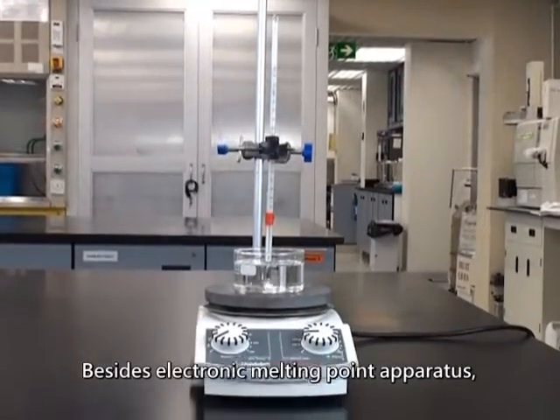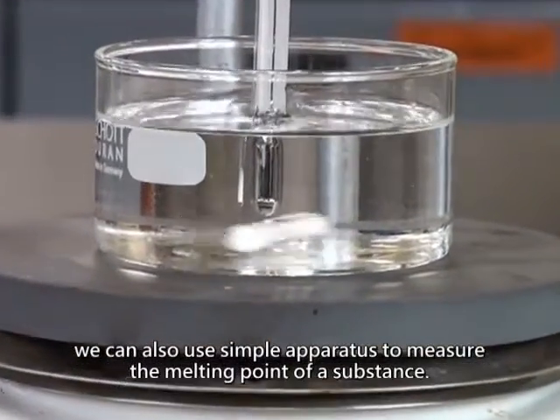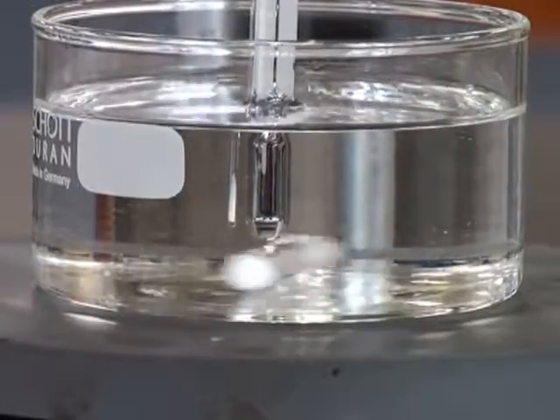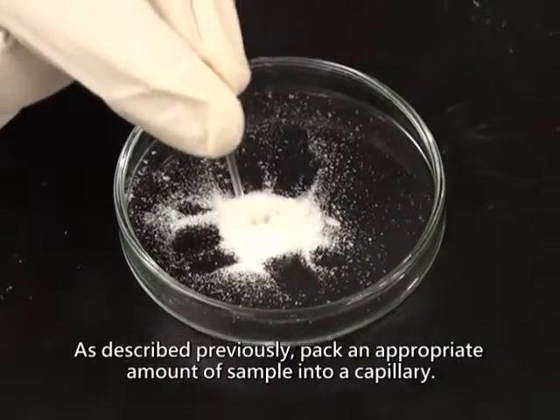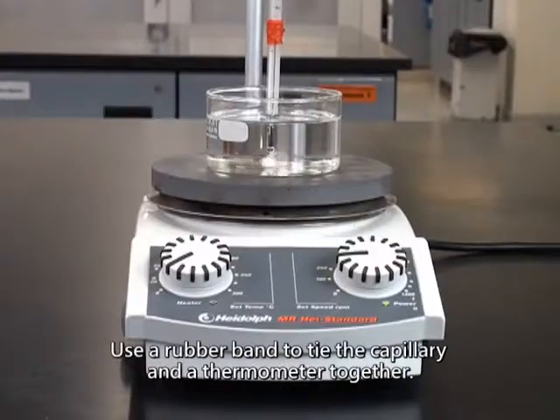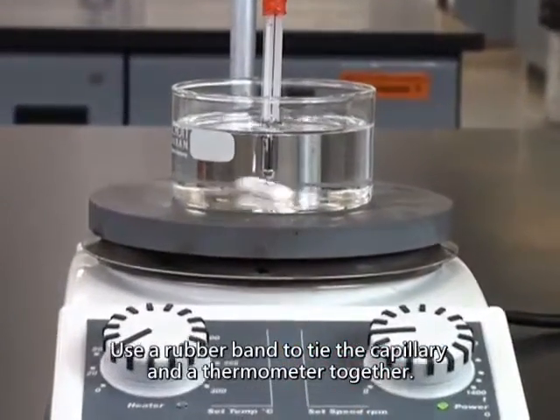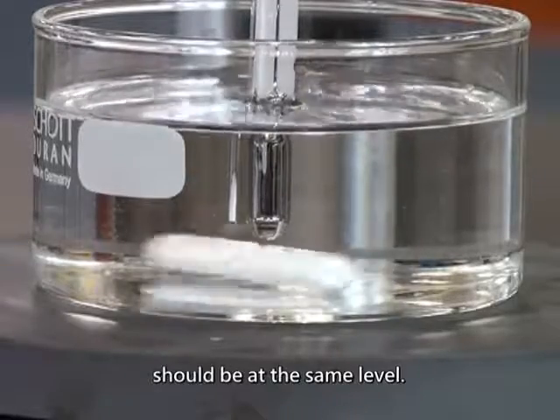Besides electronic melting point apparatus, we can also use simple apparatus to measure the melting point of a substance. As described previously, pack an appropriate amount of sample into a capillary. Use a rubber band to tie the capillary and a thermometer together. The sample inside the capillary and the bulb of the thermometer should be at the same level.